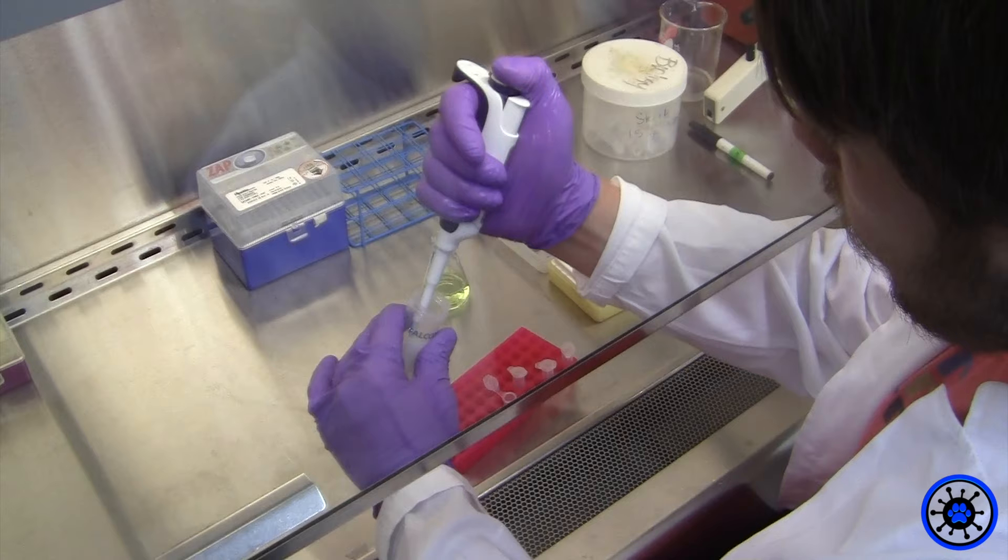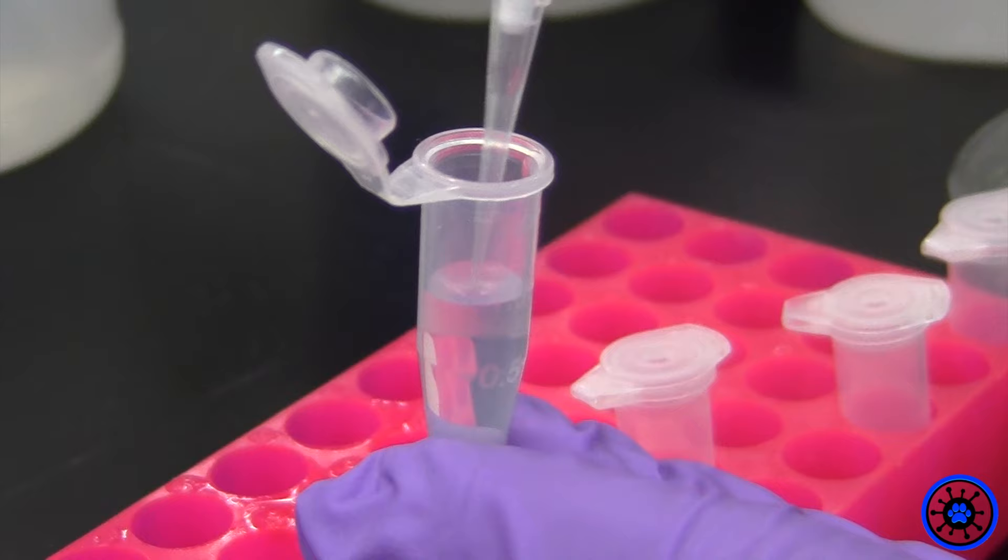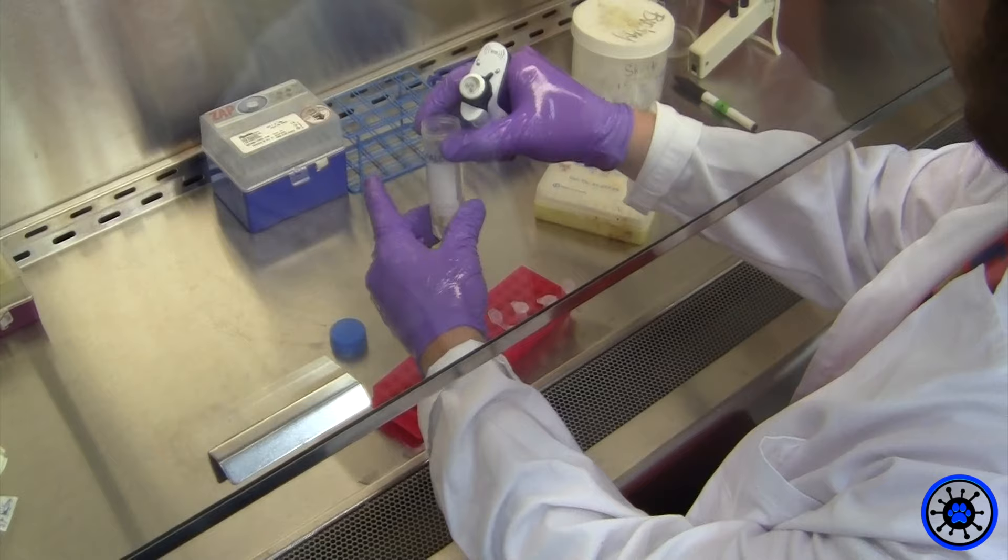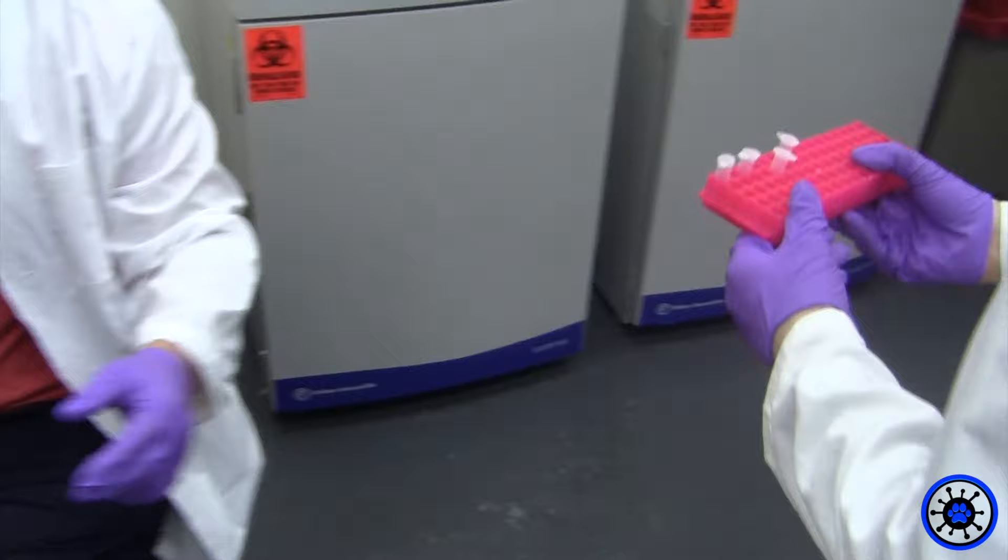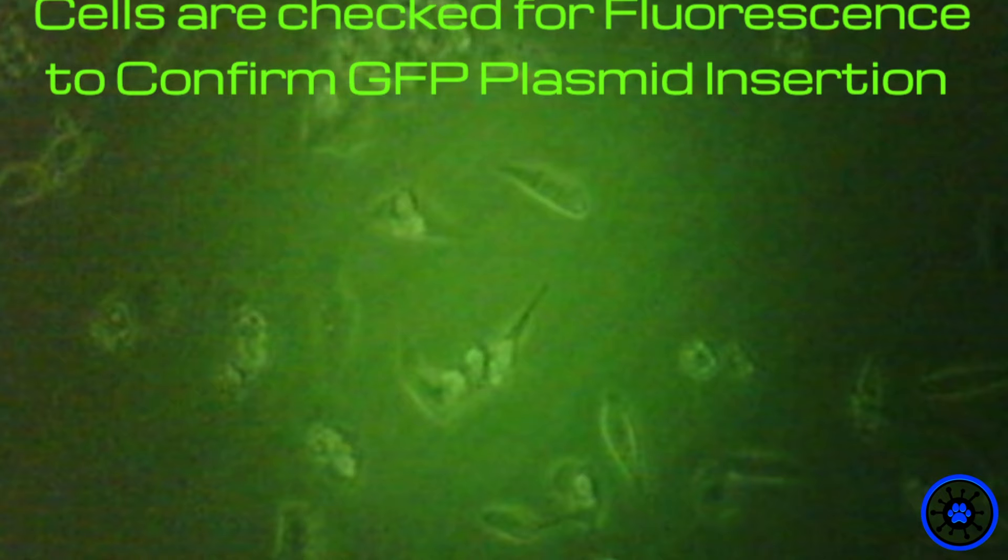Cell samples containing 0, 4, 8, and 12 microliters of the lipofectamine reagent were transfected. Incubate cells for three days at 37 degrees C and analyze transfected cells.